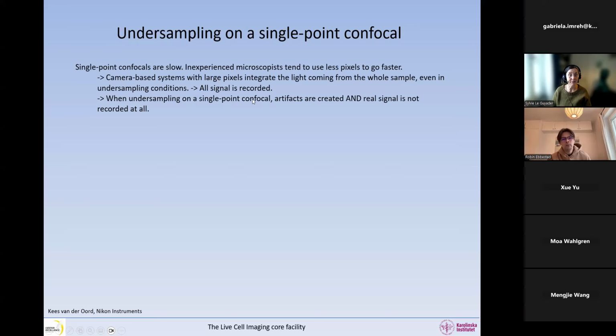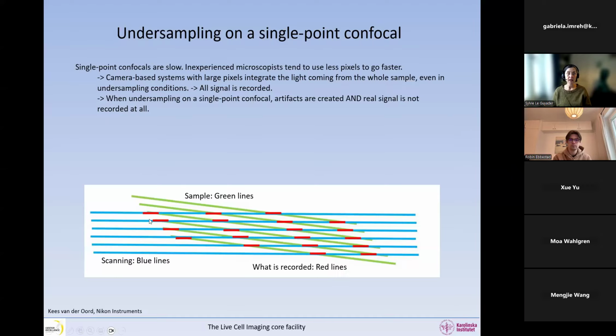We're actually jumping between spots, and whatever is between the spots, we're not measuring. So we can miss things. And we can create artifacts from this as well. So you can see here, for example, if I would have a sample that looks like these green lines, and now I'm scanning with my single point confocal, so I scan along these lines here, but I make big pixels because I want to go fast. So I jump from here to here without measuring anything in between.